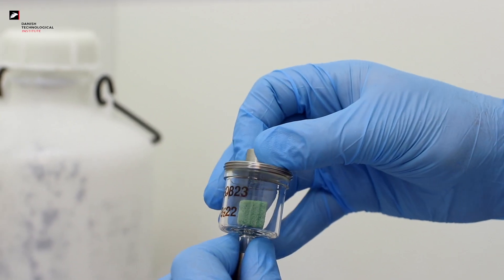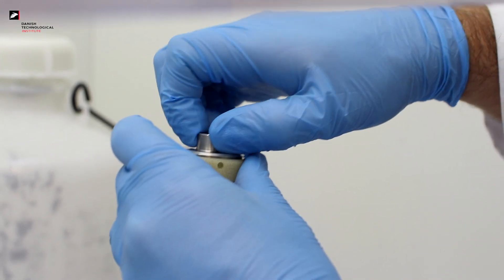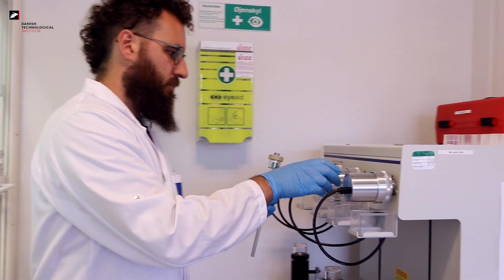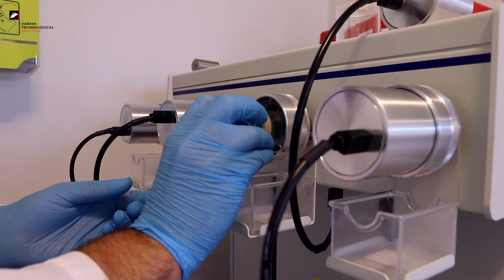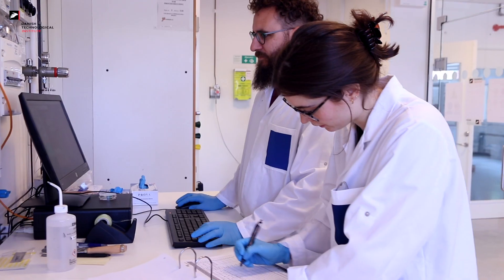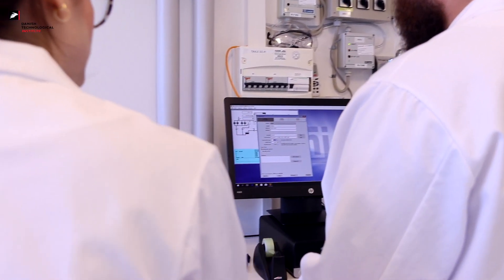With this technique you can measure a wide range of porosity, all the way down to a few nanometers and up to several hundred micrometers. One of the advantages, especially when measuring powder samples, is that you can at the same time measure the open porosity around the particles — the so-called inter-particle porosity — and the very fine pores that are usually inside the particles, the so-called intra-particle porosity.